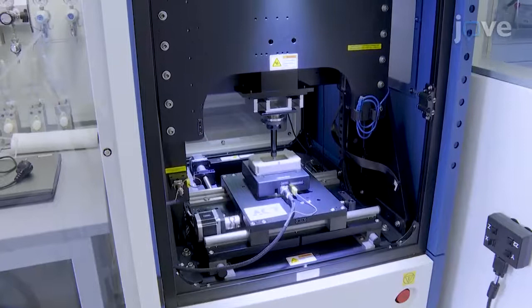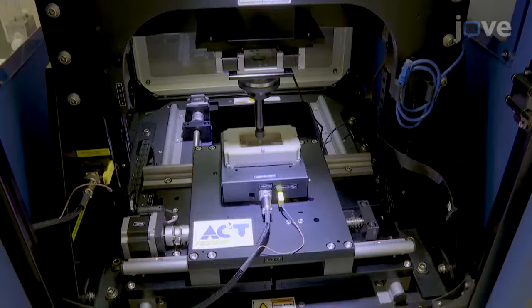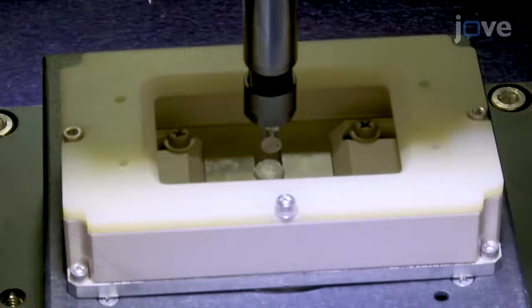Use a commercially available reciprocating tribometer with a cylinder on plate configuration, vertical loading capabilities, and adjustable load and sliding speed. Additionally, a liquid cell is required to perform the tests in a lubricating solution.